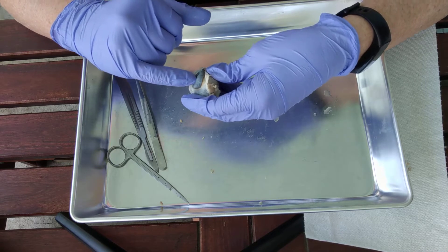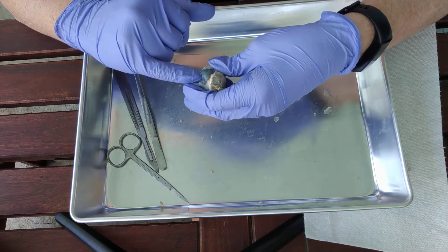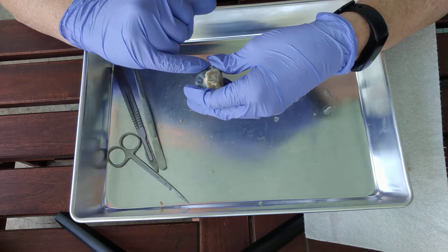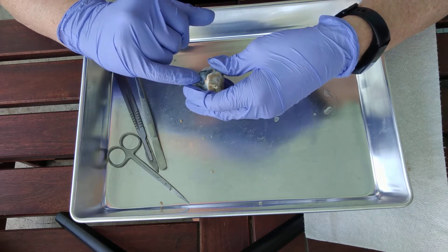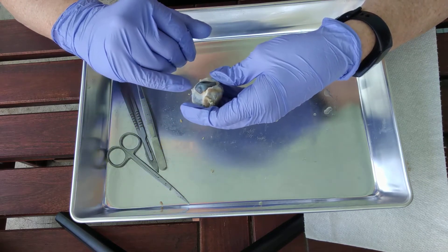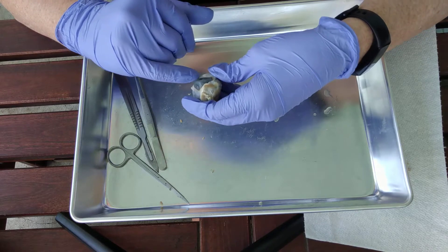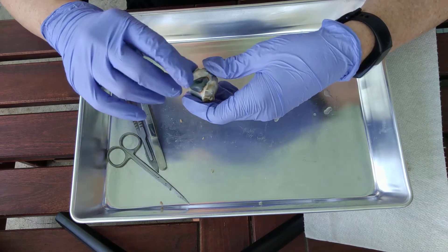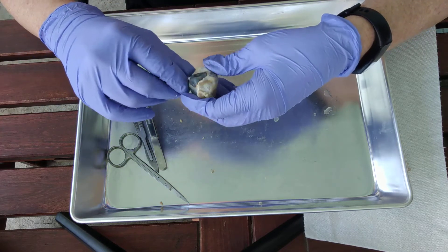What color is the cornea in real life? Is it usually this milky, cloudy, white color? No. Usually it's clear, and the only reason it is not clear is because of the preservative — it makes everything darker and cloudier. In real life the cornea would be nice and clear because the light has to pass through it. Think of it as the window for the eye.